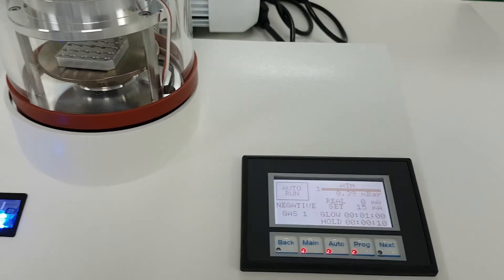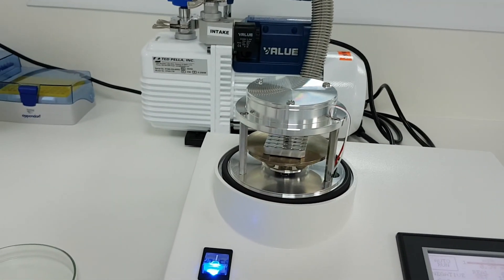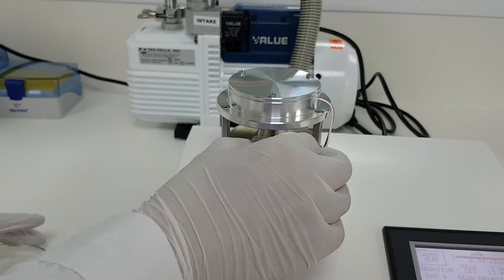Once you check this on the screen, you can open the glass lid, remove the grid metal support, and place back the lid.